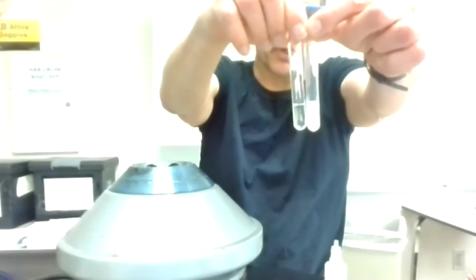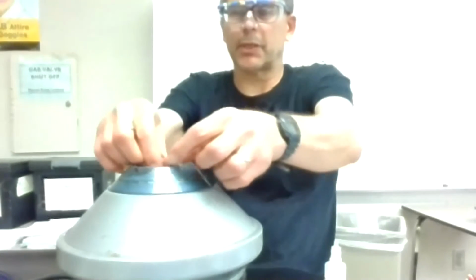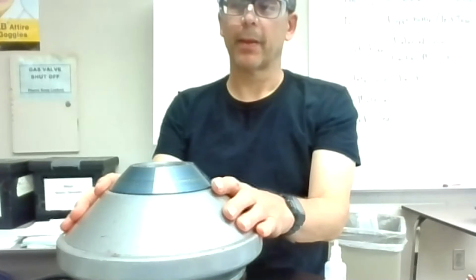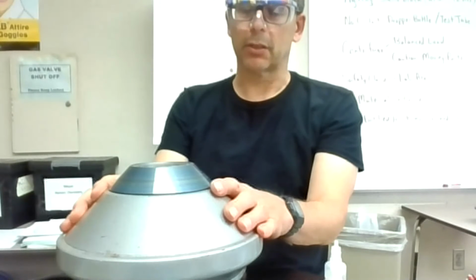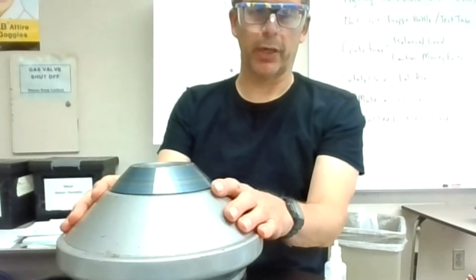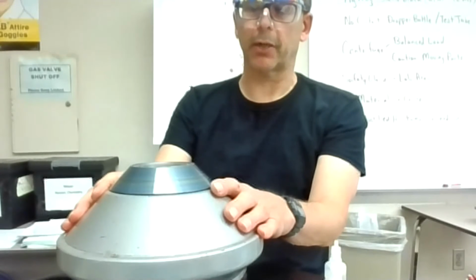This is a pretty definitive test for the cloudiness. Sometimes you don't even see this much cloudiness with this one. We'll centrifuge that. For this third test, that's definitely enough cloudiness to see.